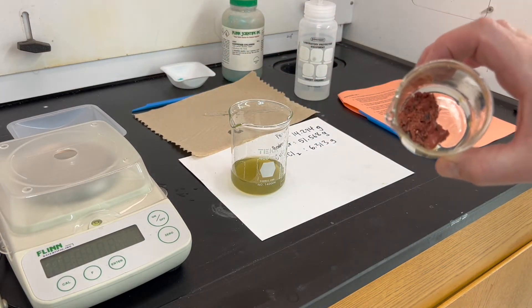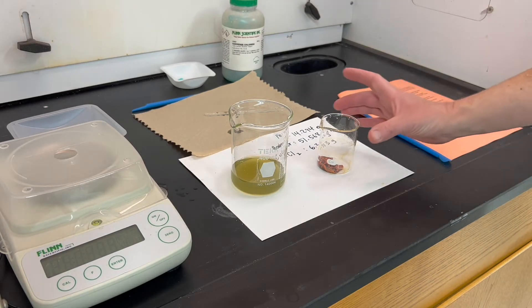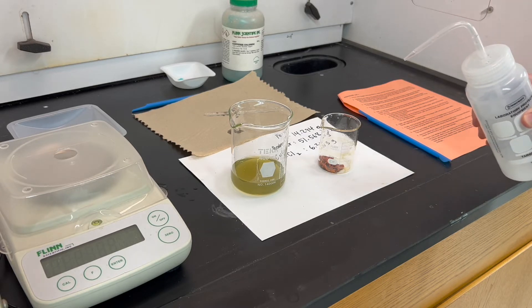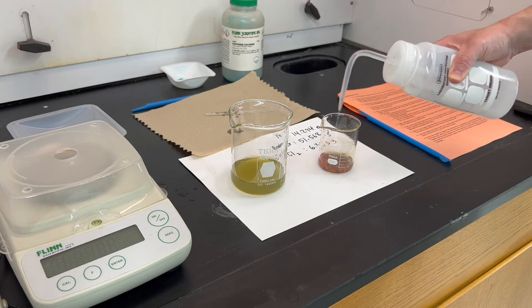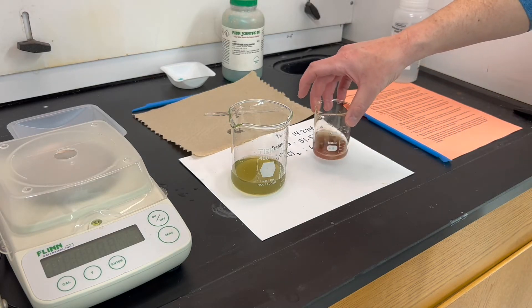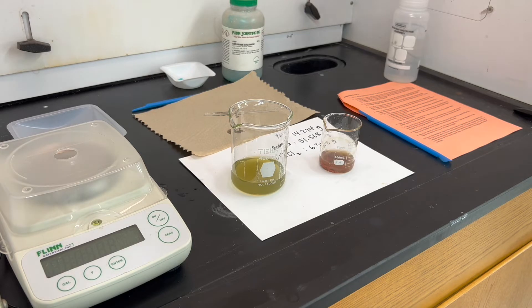There's a good deal of copper in here to clean over the next couple of steps. Don't pour off the last bit of solution; add about 25 milliliters of distilled water to rinse the copper — it doesn't need to be exact. Swirl it a little bit, let the copper settle for a minute or two, then repeat the decanting process. You should complete three cycles of decanting, rinsing, and decanting again.